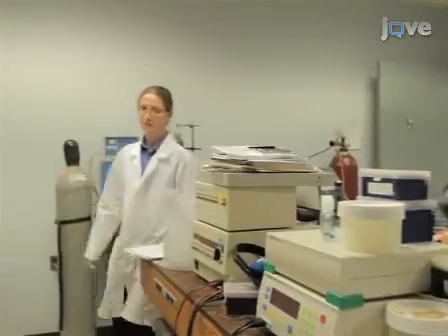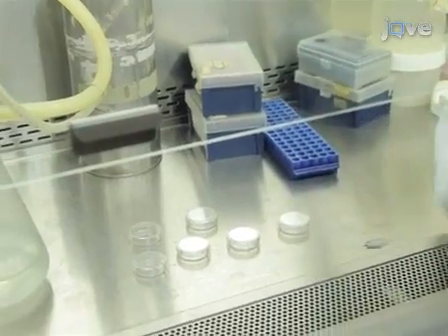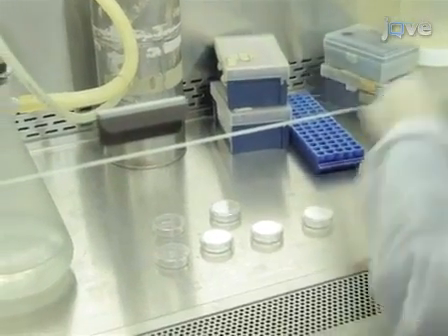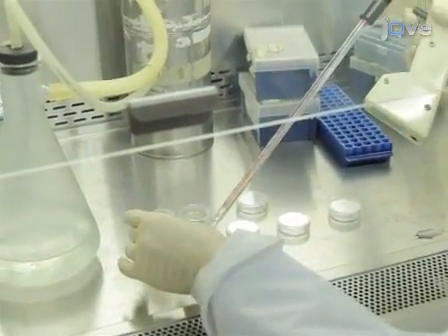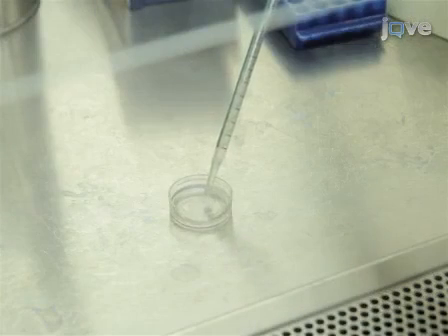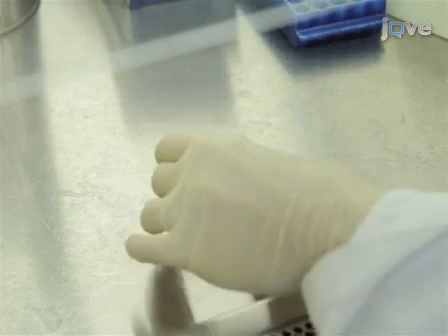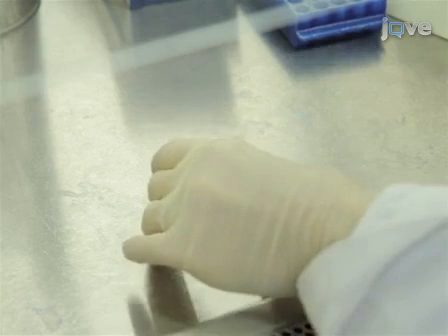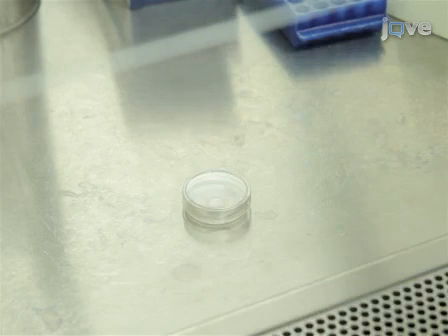The day before beginning the procedure, coat 35mm glass bottom viewing chambers with 10 micrograms per milliliter of laminin. The next day, plate 1 milliliter of freshly isolated cells suspended in KB buffer in the chambers for 45 minutes.